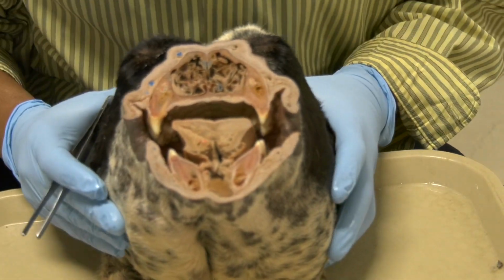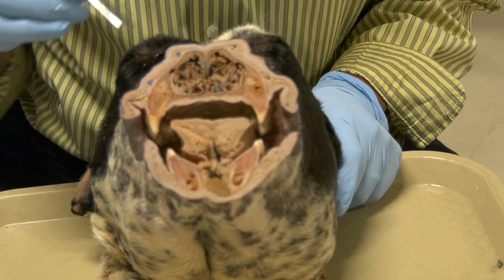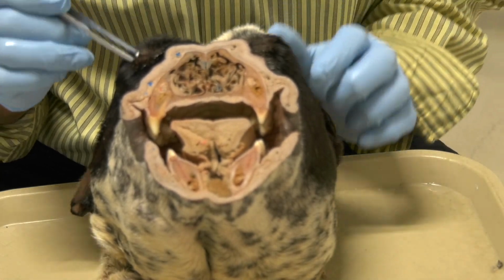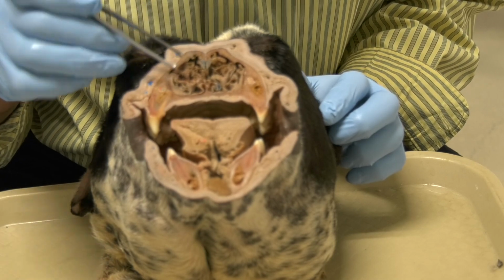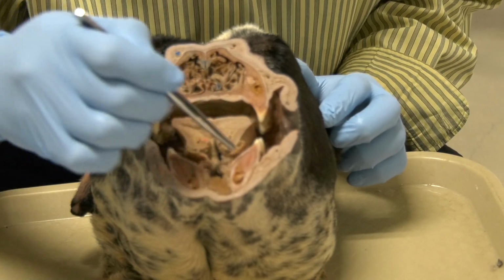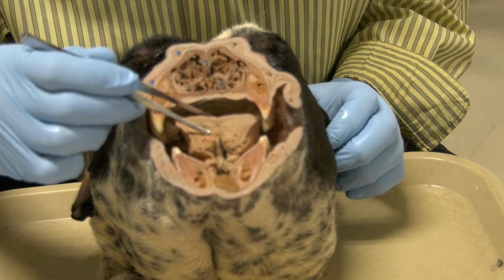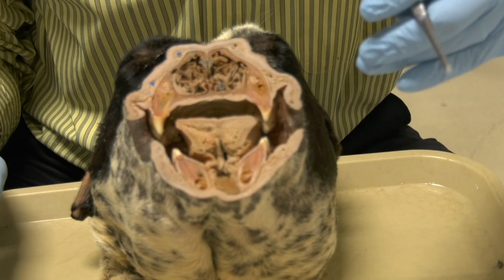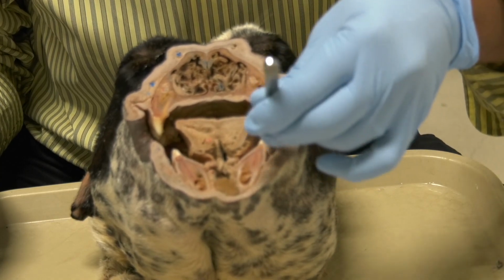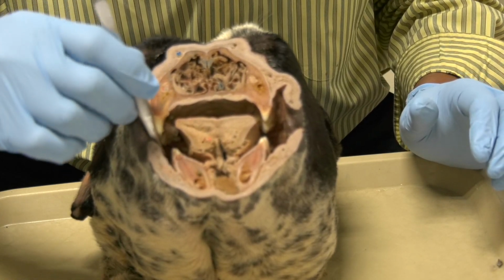Lastly, this is a transverse section at the caudal part of the nasal cavity. This is the ethmoidal concha. These are the eyes, as you can see. Okay, this is the tongue here. This is the mandible. These are the molars of the lower jaw, and those are the molars of the upper jaw. This is the hard palate. This is the tongue. Now, the space that you see here between the cheek and the dental arches, this is the vestibule, okay, on the left side, and this is the vestibule on the right side.